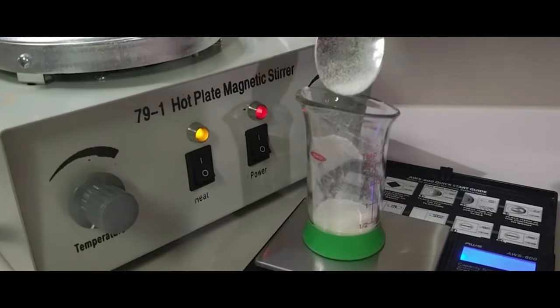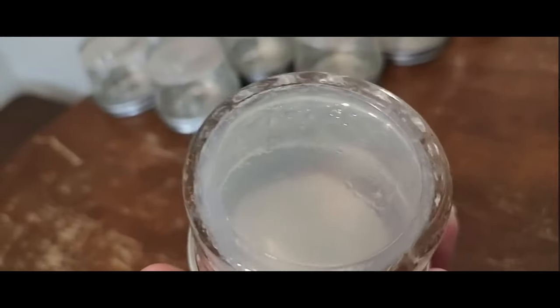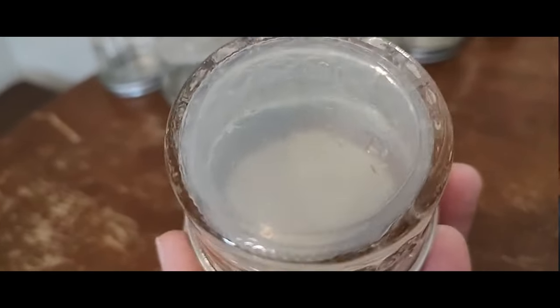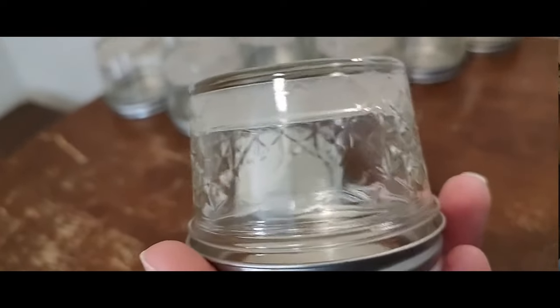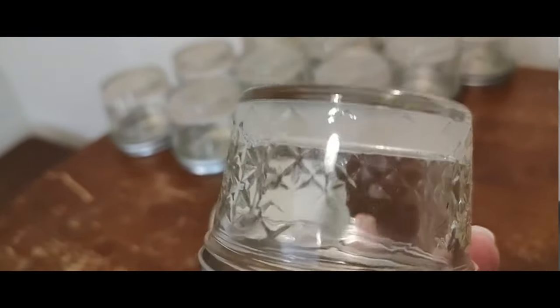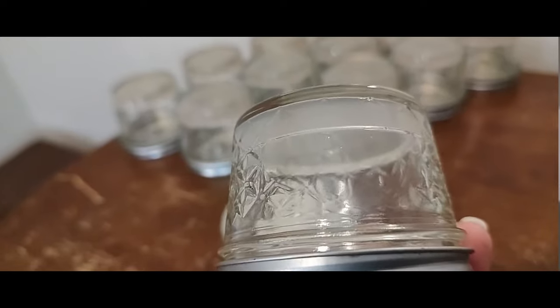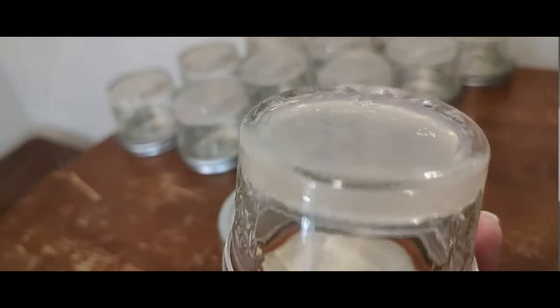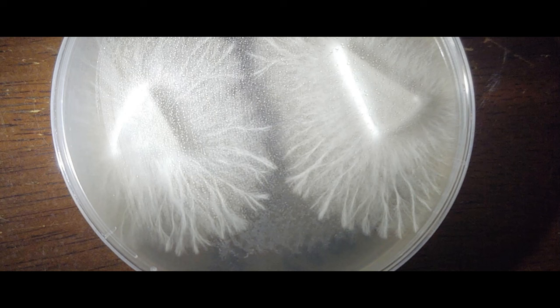Through much research, we found that adjusting levels of nutrients really changed the growth to a more rhizomorphic pattern. Multiple transfers using different agar recipes helped us achieve the growth we were looking for. When we dialed back the malt extract a little, the mycelium seemed to stretch out searching for nutrients while containing and or eliminating any contamination.